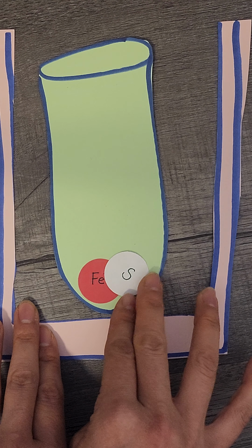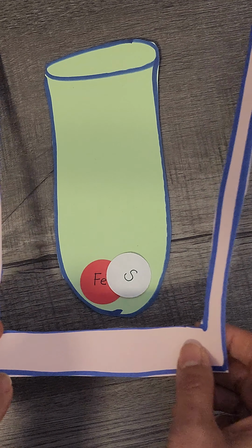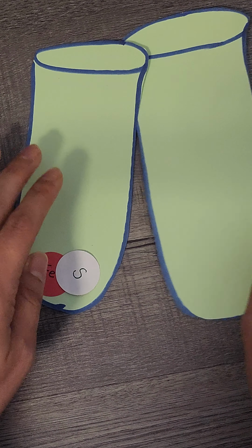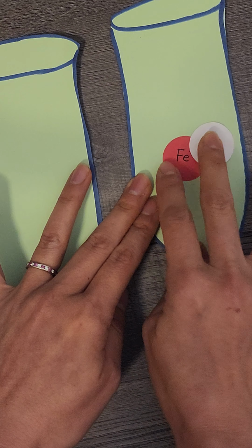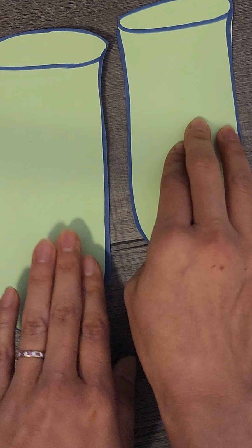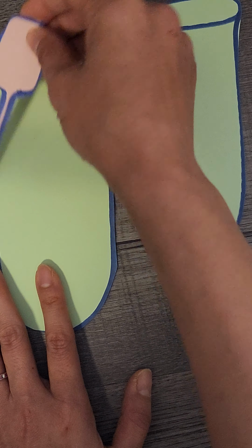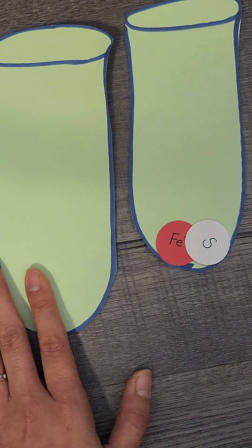Okay, so now we have this. What you're going to do, again, take it out of the boiling bath, add water, balance this out, and then spin it so that the content will sink down and the rest of the residue, the supernatant, will be taken up by a pipette. I'm going to put this in the waste, or you could put it in a clean test tube.